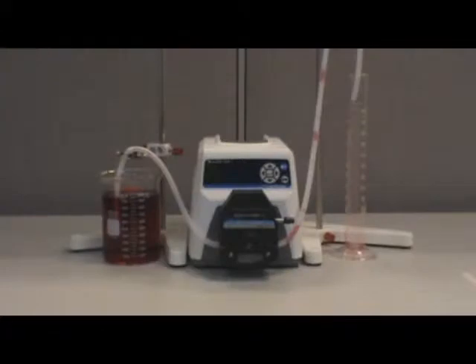The items that you will need to calibrate your MasterFlex LS variable speed digital drive will be a beaker or container of water, a graduated cylinder, MasterFlex pump head, and MasterFlex tubing.